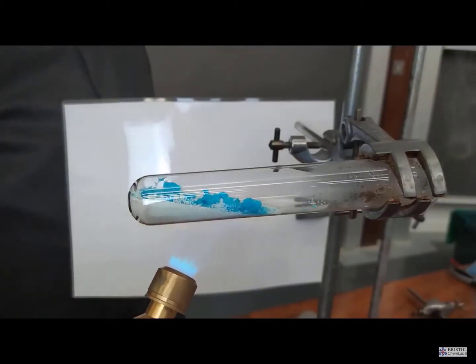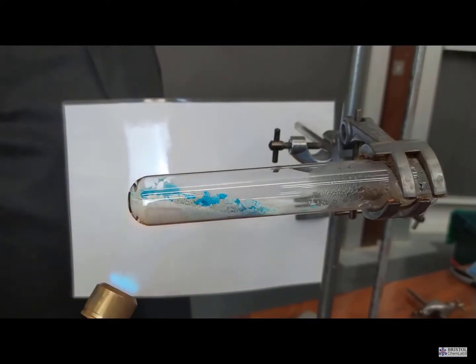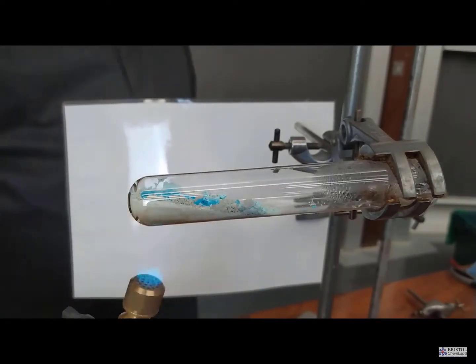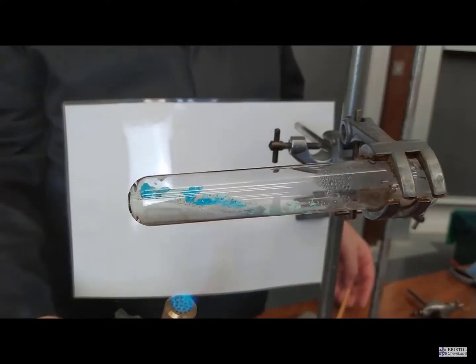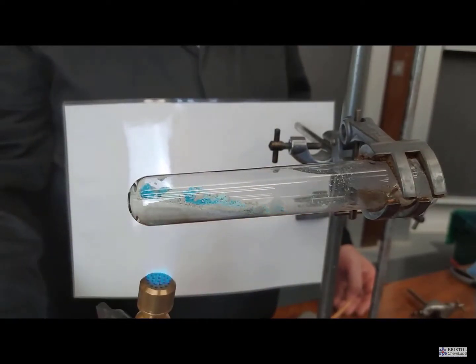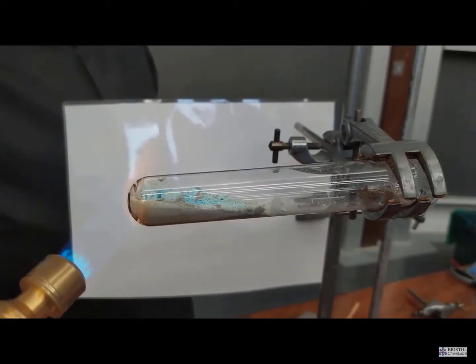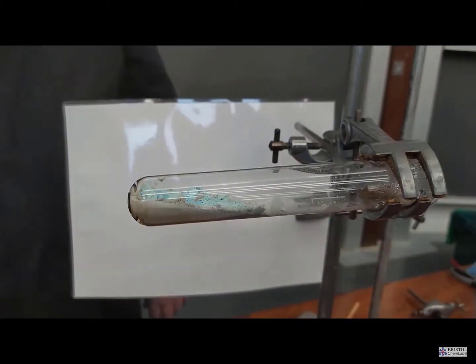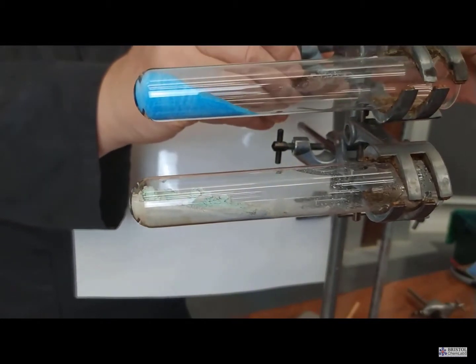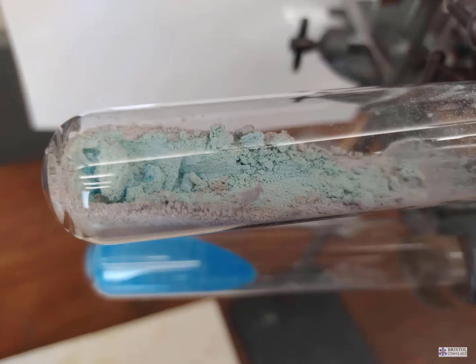So heating the crystals with a strong flame allows that water to be driven off by breaking bonds that the water has with the copper ions and the sulfate ion, and that water can be condensed, as you can see in the video, at the top of the tube. When water has been removed, the material left behind is known as anhydrous. So the white anhydrous copper sulfate is a residue.